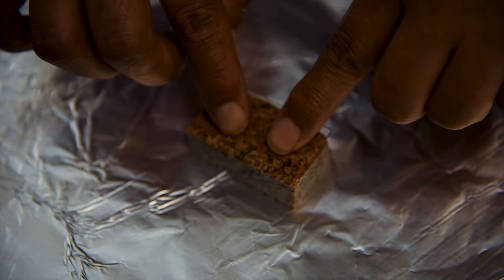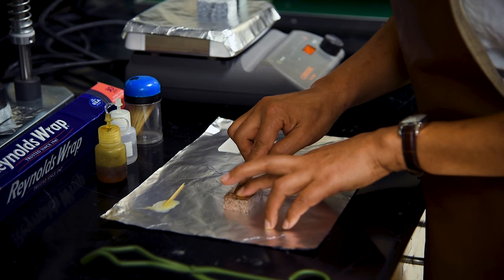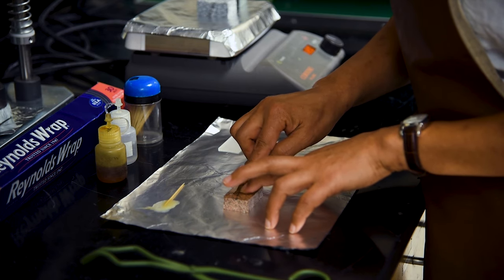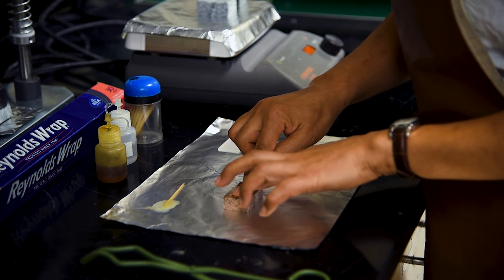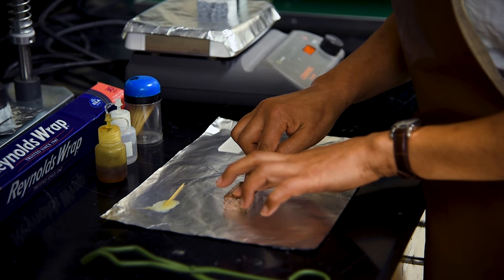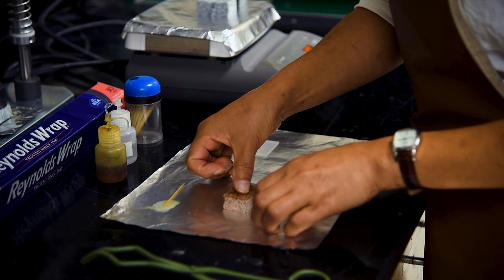Using a soft pencil eraser or even just your fingers, press down on the slide and move it around gently to squeeze out the extra epoxy and achieve a constant thickness, and also to remove any air bubbles that may have been trapped. Although most sample chips will have cooled down some, be cautious while applying the glass slide as it may still be slightly hot to the touch.